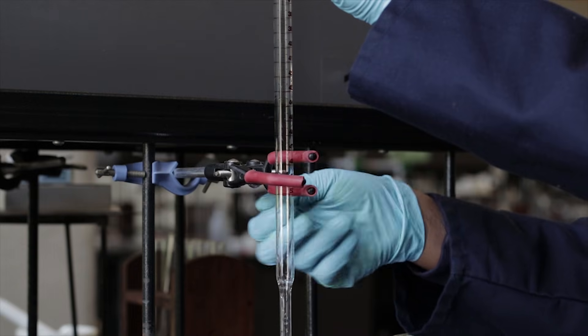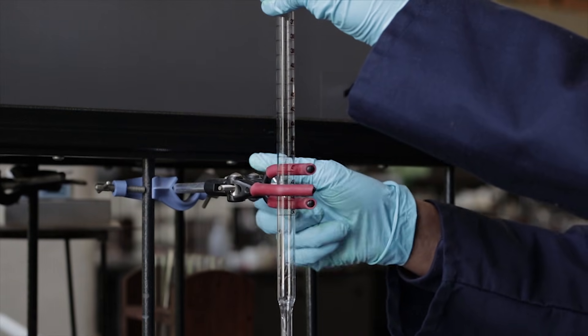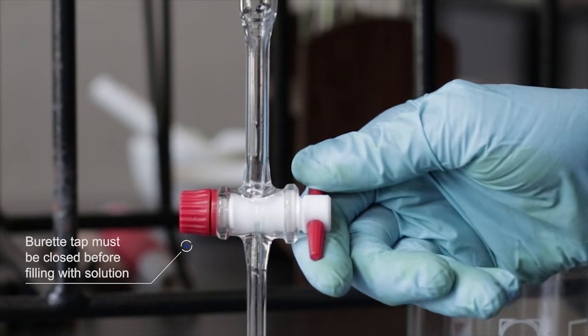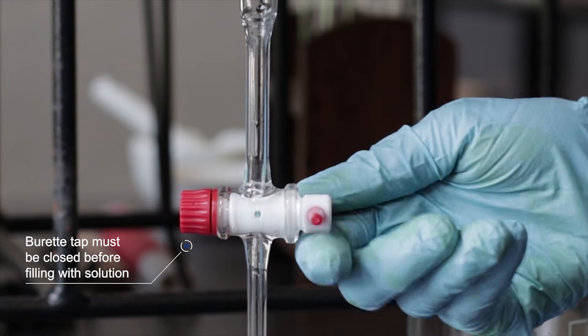Once the burette has been cleaned, the burette must be rinsed with the chemical solution first before it can be filled.